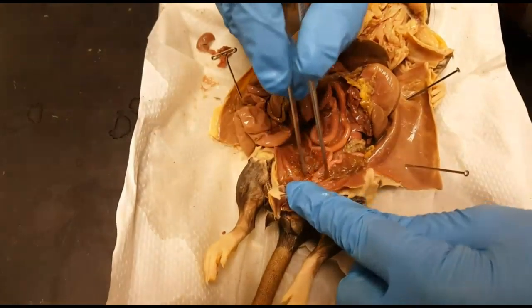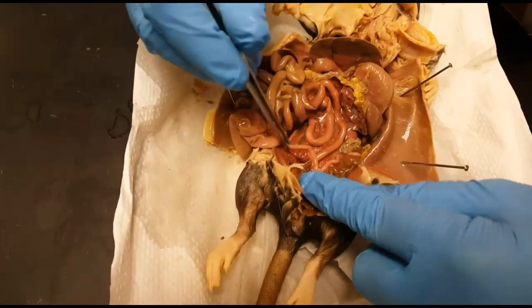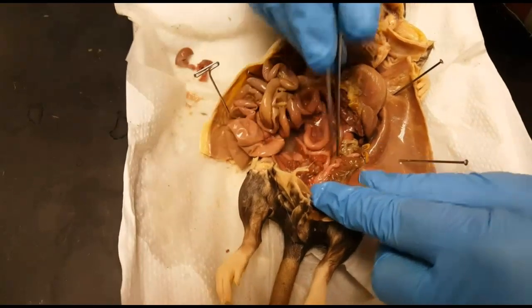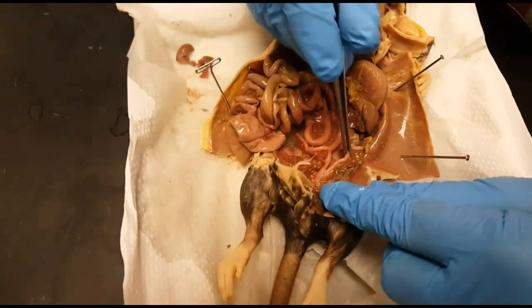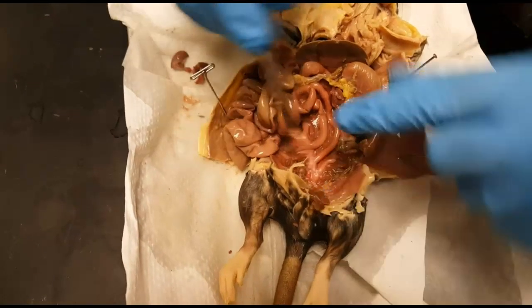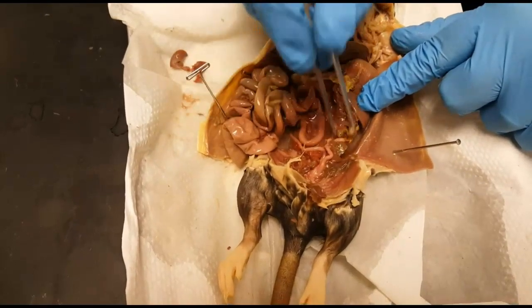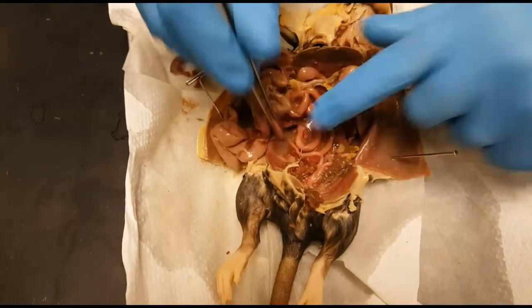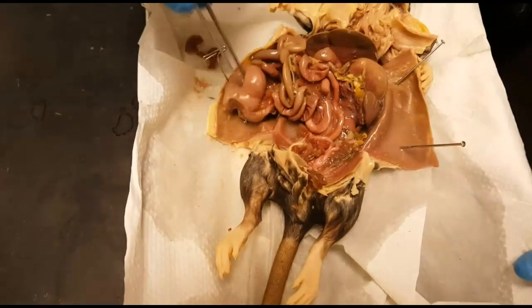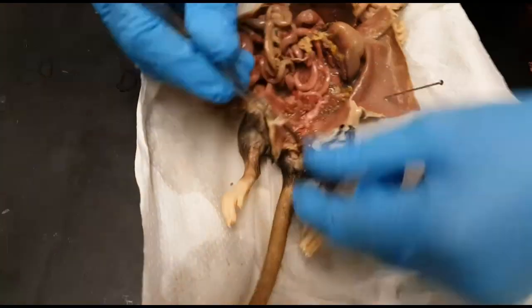Down at the bottom we see two tubes — don't confuse them with the intestines. These are the fallopian tubes, so this is a female rat. At the back end, at the terminal side, we have ovaries attached to these fallopian tubes.